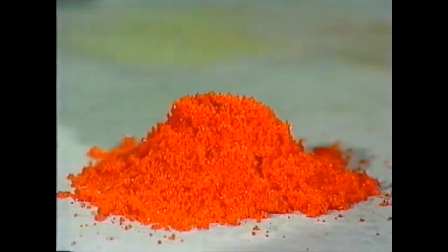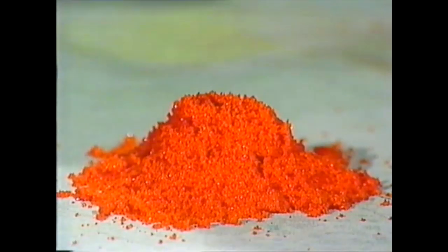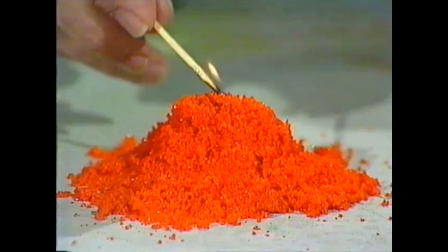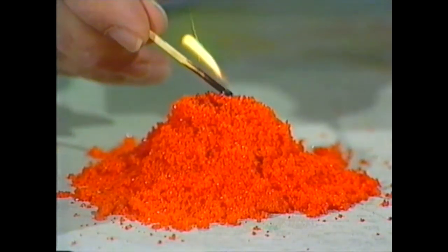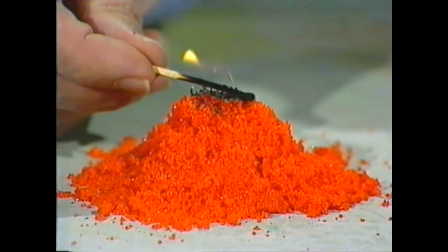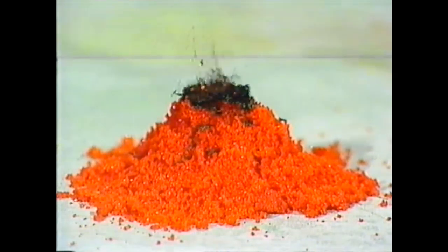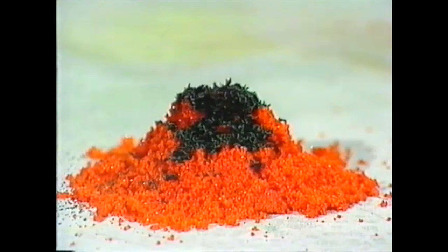You make a little mound or heap of ammonium dichromate and then heat it up. You can do it with a Bunsen burner or a match. It's interesting stuff because it starts reacting with itself — you can hear it fizzing and popping, and you may see a few sparks. When it starts to react, it produces more heat so it continues to react, and you can take the match away after a while.